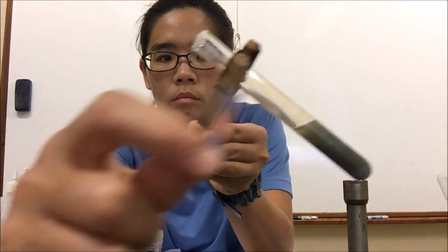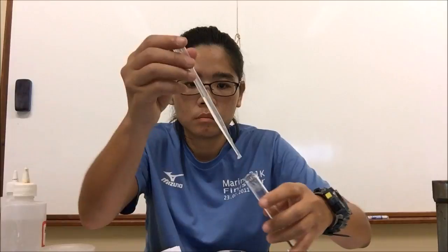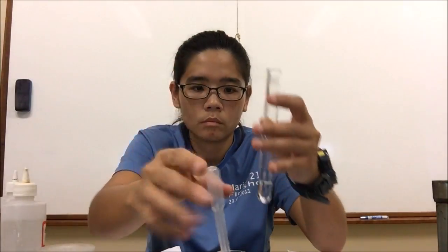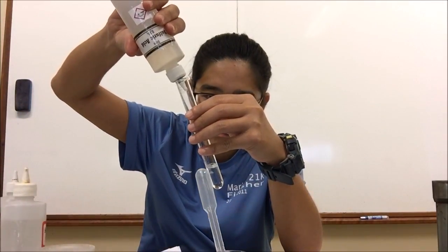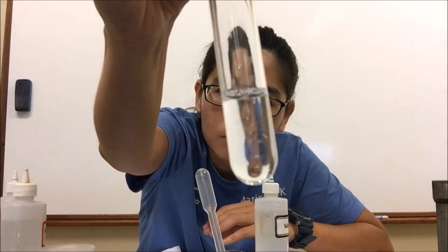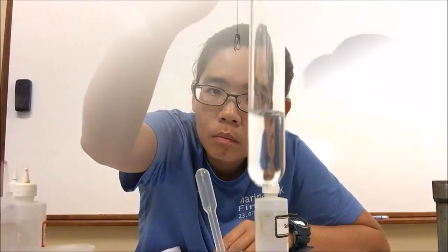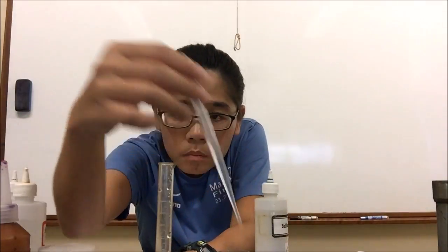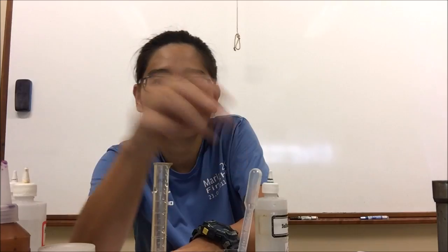Still working with solution P, I take another portion — 2 cubic centimeters of solution P. Note that solution P is not a colorless solution; it has a shade of green to it. I add 2 cubic centimeters of P to a boiling tube and make up to 10 cubic centimeters using deionized water.